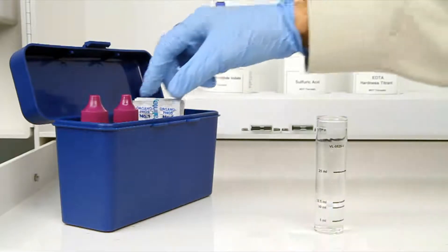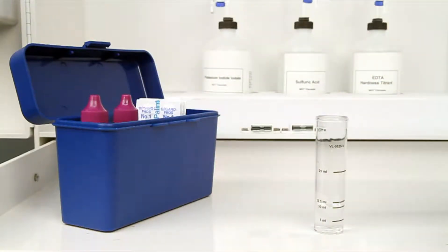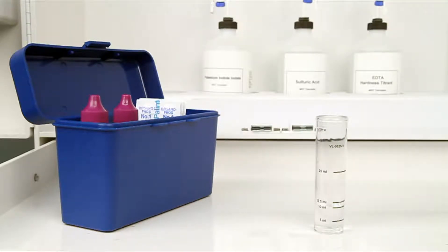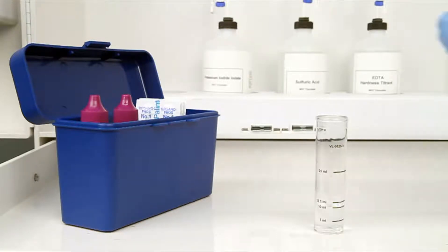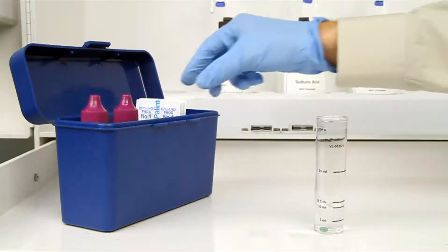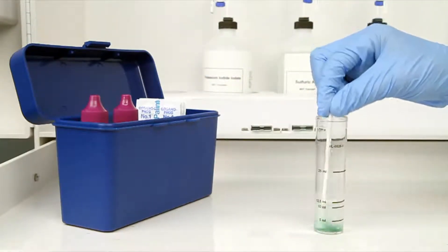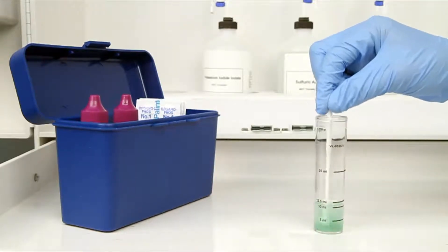Once you have gathered an accurate sample, the next step according to the Endpoint ID procedure is to add one OP tablet. Once you have added the tablet to the vial, use the tablet crusher to crush the tablet and then swirl the vial to make sure it's completely dissolved. A green color should develop.